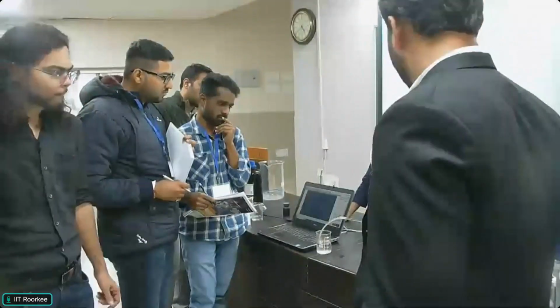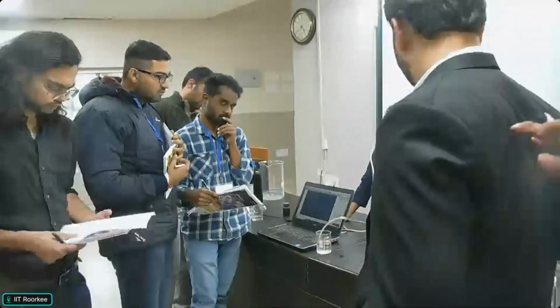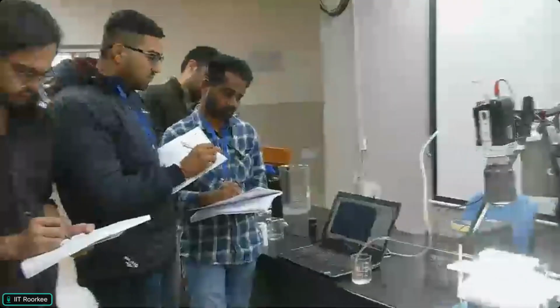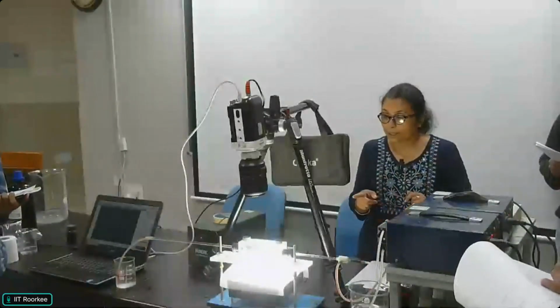Its diameter is 2 mm, length is around 60 centimeters, and we have two fluids. One is water. So this is the pump, the peristaltic pump for water, and this is the pump for solvent. This tube is first washed with ethanol, then air dried, then we are using it.